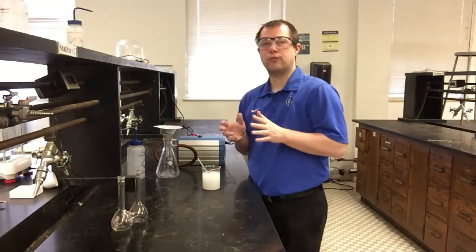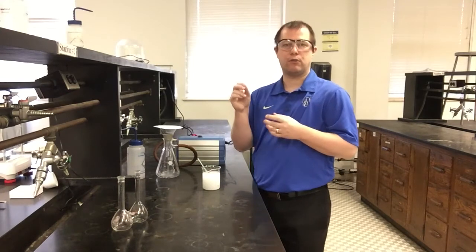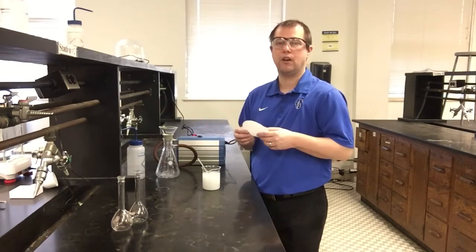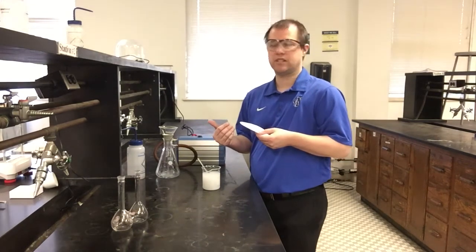So what we're going to do for our filtration step here, we're not going to do the gravity filtration the same way that we had done previously that we kind of showed in the mixture lab a couple weeks ago. In that one, we basically just kind of set up a funnel with a piece of filter paper in it and just kind of slowly let things drip through with gravity pulling it all through. We want things to go a little bit faster this time, and because we want to dry our final product, we're going to use something called vacuum filtration for this particular experiment.